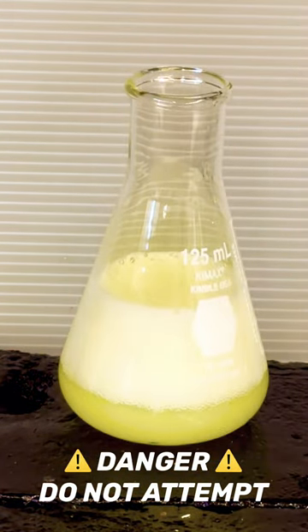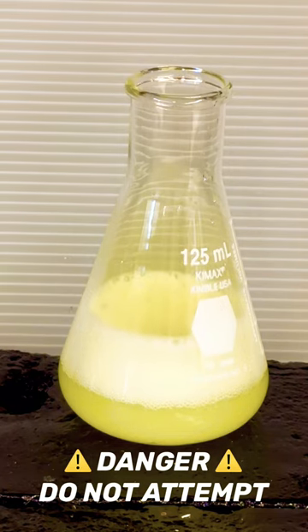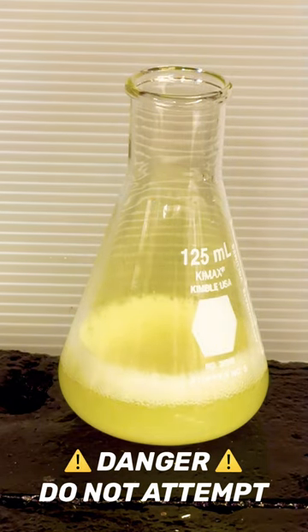Don't do this at home. I've done this in a hood with the proper safety protocols in place. If you look above the foam that's generated, you can see the pale yellow chlorine gas.